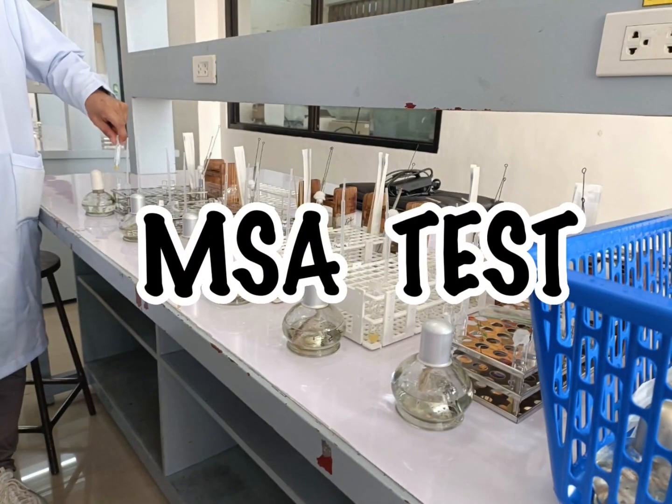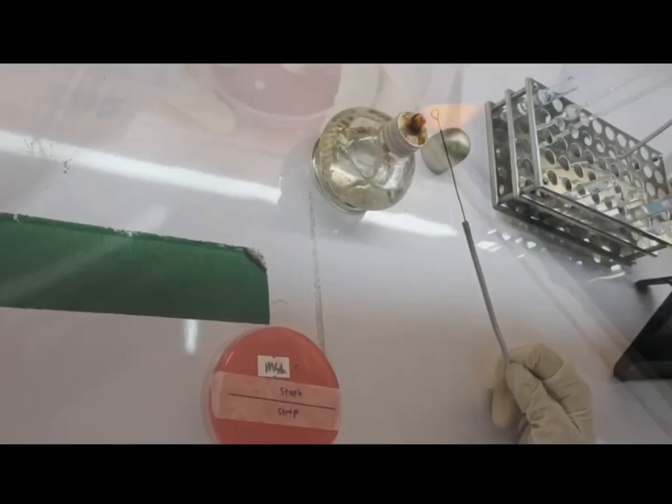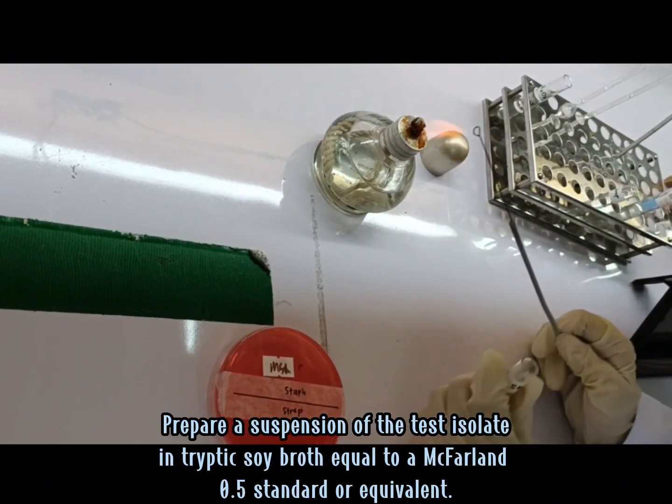MSA is used as a selective and differential medium for the isolation and identification of Staphylococcus aureus from clinical and non-clinical specimens. MSA distinguishes bacteria based on the ability to ferment the sugar mannitol. Colonies that can ferment mannitol will appear yellow, while colonies that can't ferment mannitol will appear pinkish. Let's begin our MSA test for our Staphylococcus and Streptococcus.